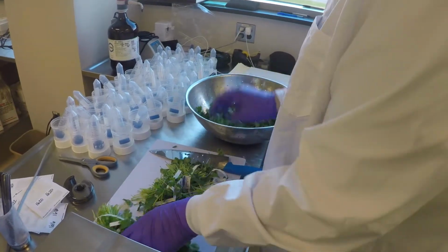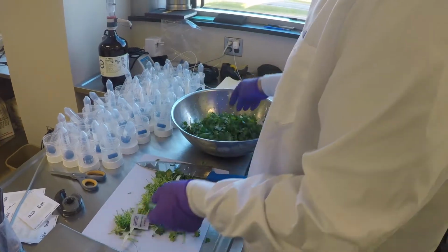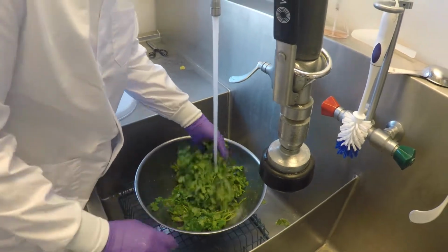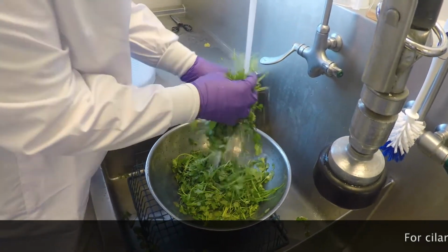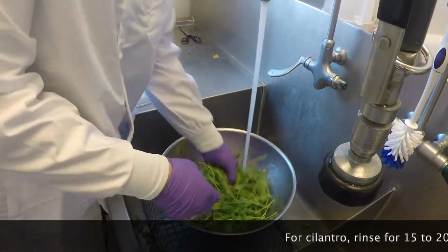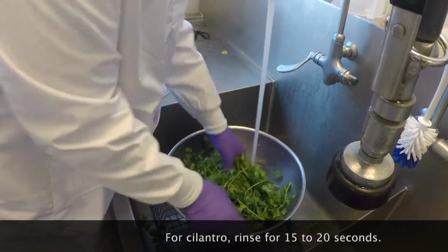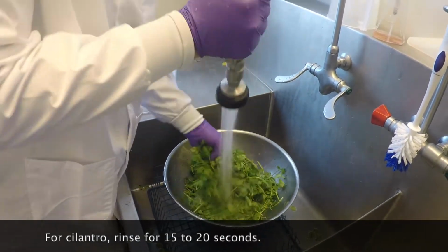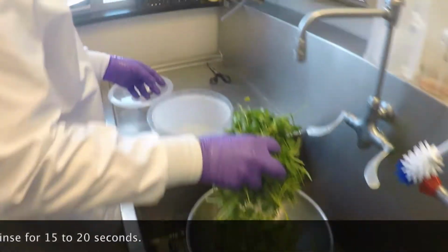Cut the sample, if necessary, into pieces that will fit into the homogenization device to be used. If the entire sample does not fit into the homogenization device at once, then the sample may be homogenized in portions. All portions shall be mixed together in a clean container before weighing. Use the appropriate device for the sample type and size. Mechanically chop the sample to form a visually homogeneous mixture, mixing the sample during the process as needed.